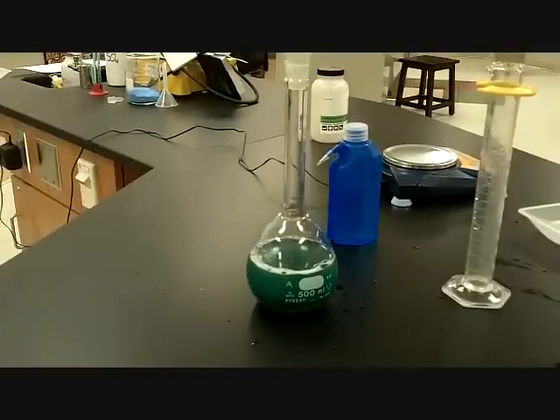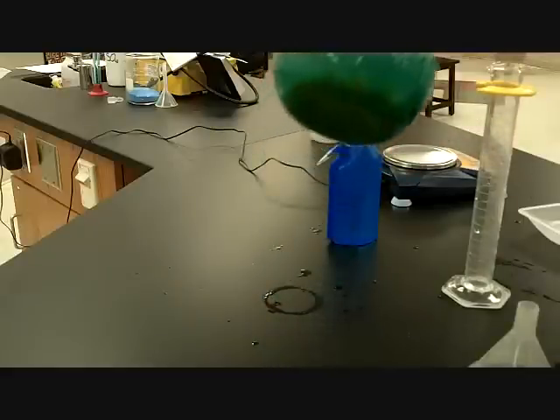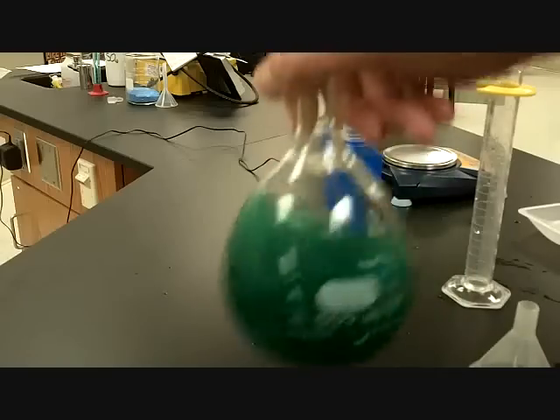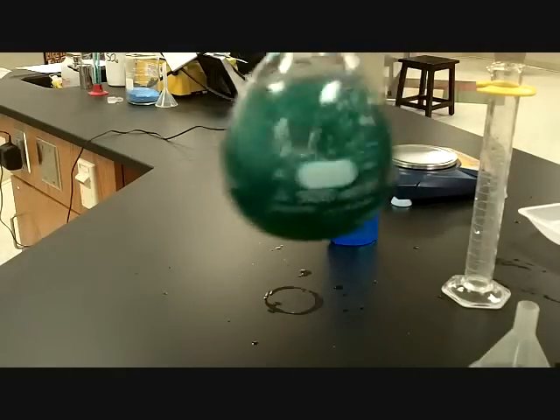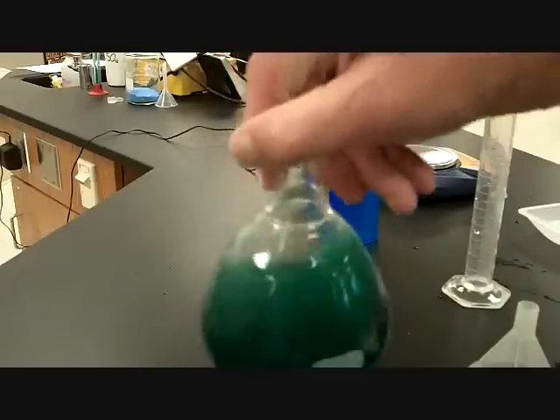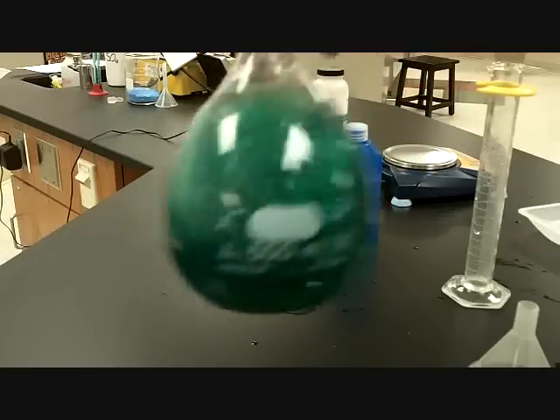Now, what's really neat about this is, we know based on solubility rules that nickel chloride is soluble. However, I bet if you looked on the bottom of this, you'll still see some crystals on there. So typically what we want to do now is shake it up a little bit. Mix it up, stir it. Sometimes we may need to put a stirring rod in there. If I put a stirring rod in there right now, you won't be able to see it, a magnetic stir. So we'll just keep shaking it up a little bit, dissolving it.